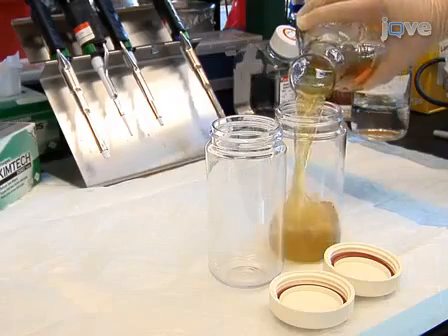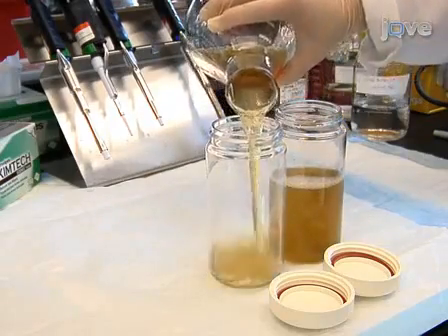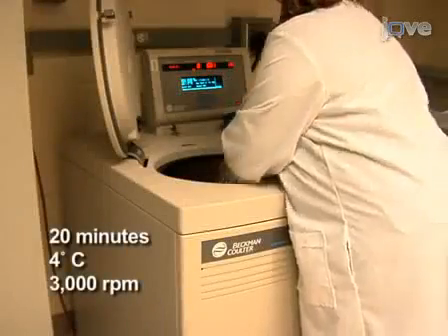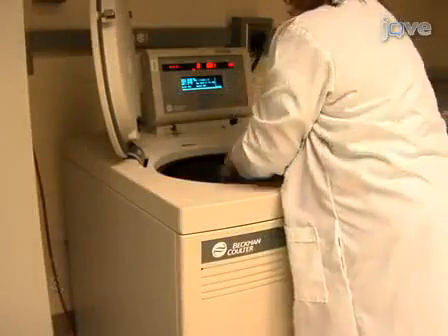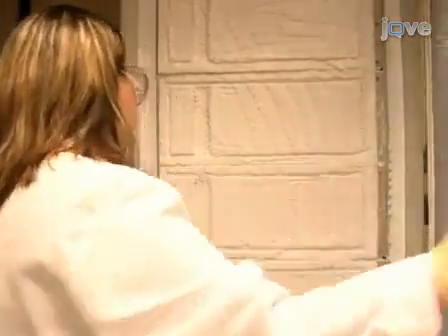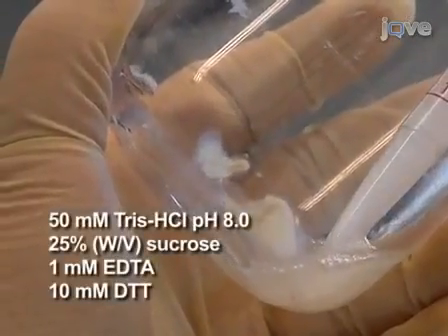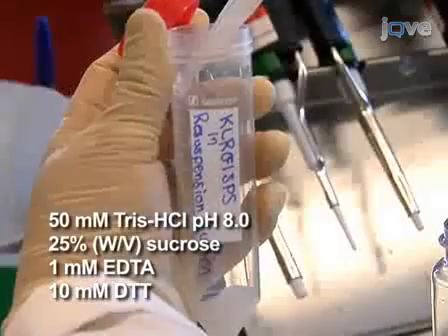Following the 4-hour incubation, transfer the bacteria to centrifuge tubes and spin the cultures down for 20 minutes at 3000 RPM and 4 degrees Celsius. If necessary, pellets can be frozen at -80 degrees Celsius at this point for use at a later time. Resuspend the harvested cells in 30 milliliters of resuspension buffer.